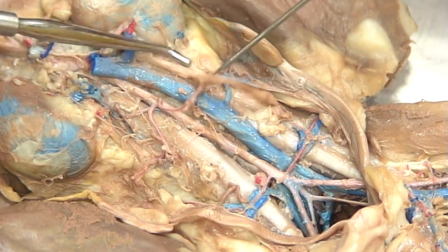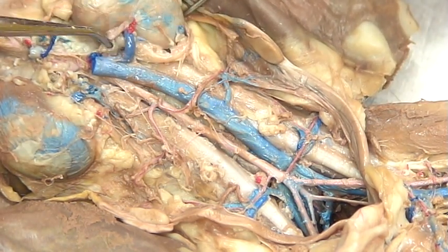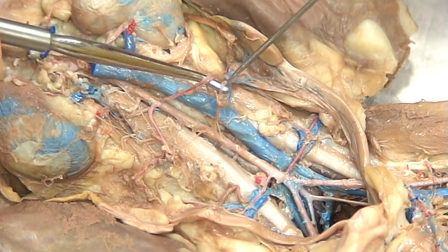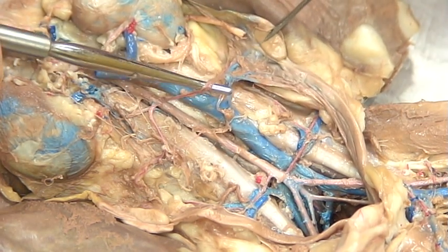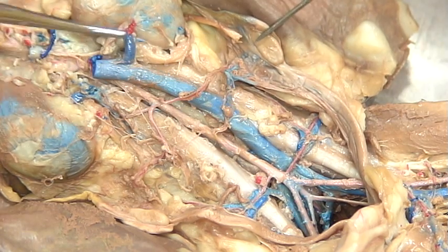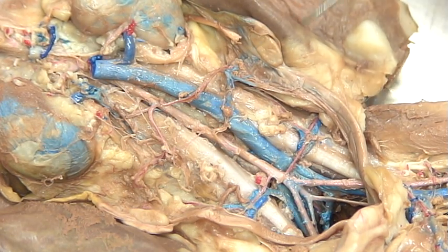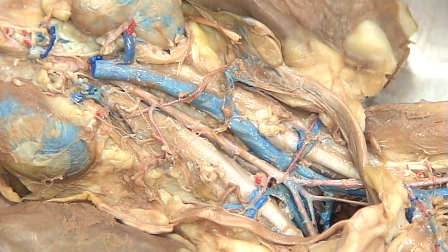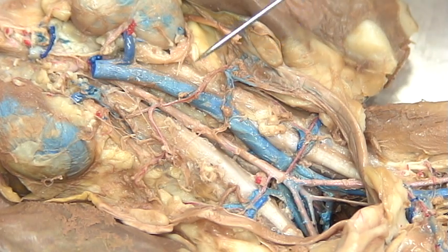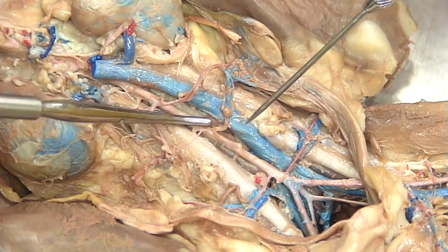As we work our way down, I'll move this duct from the kidney out of the way. We're going to be seeing an artery that feeds into the ovary itself, so this is going to be a genital artery. You're going to find it has a different track if it's a male cat, so the genital artery is going to be a little bit trickier to see because of the sex of the cat.